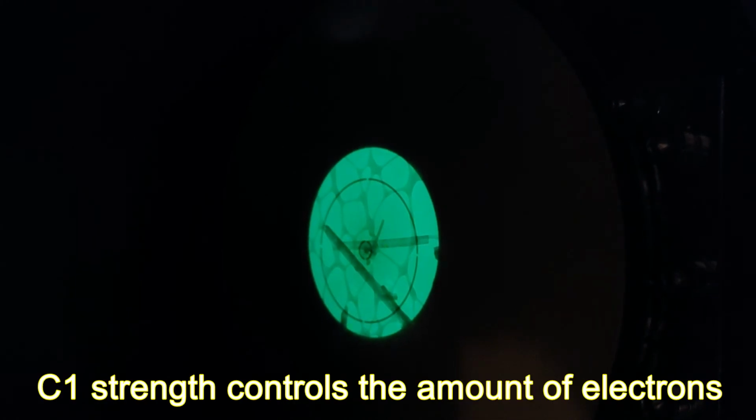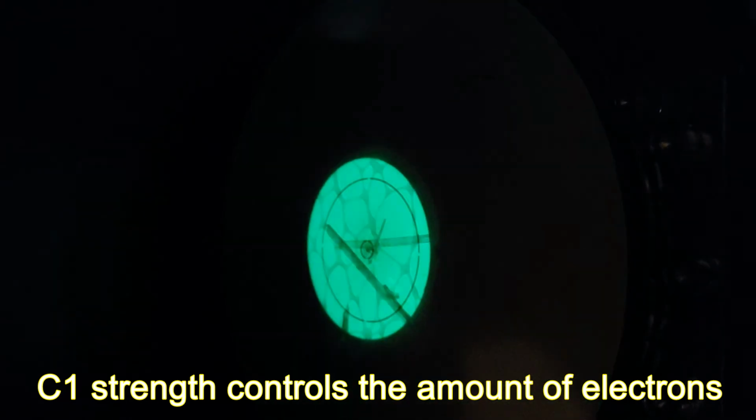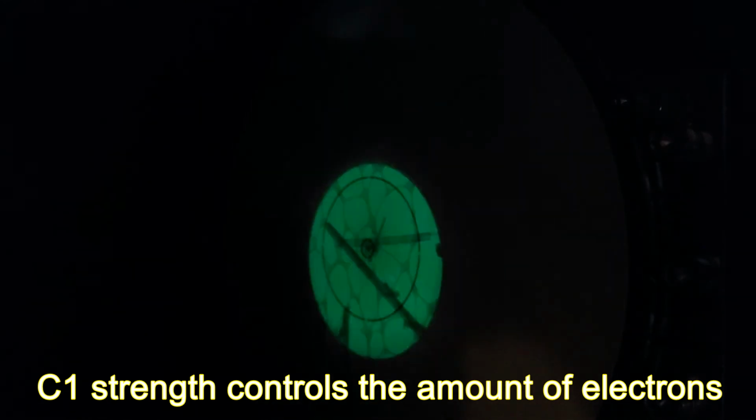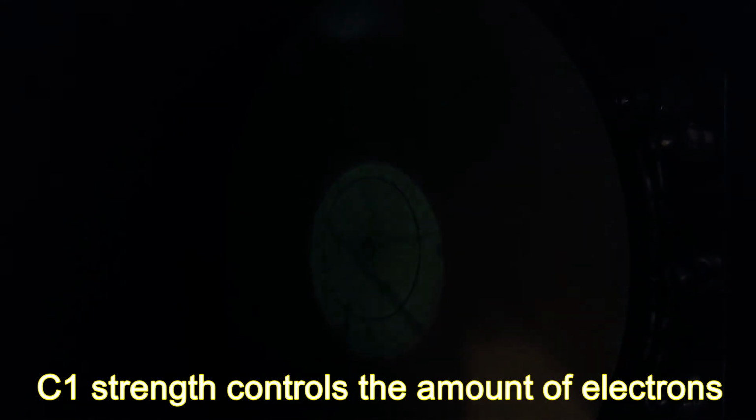If I change what's called the spot size, that's the C1 lens, then I change the brightness, but not the size. So we have this curious situation that the spot size changes the brightness and the intensity changes the size of the illumination. Now I raise the magnification, going up in steps. I can jump up, and I need to converge the beam to illuminate the proper area.